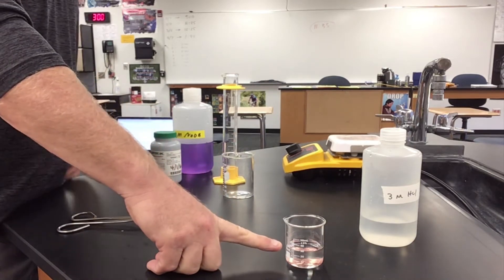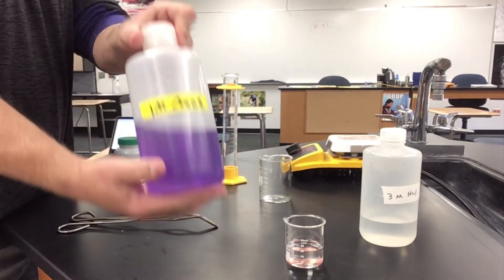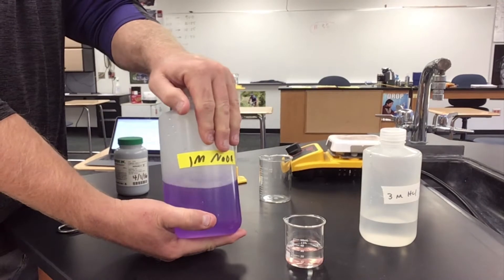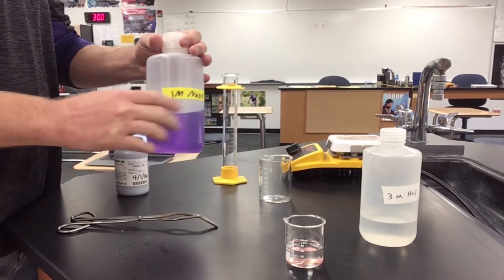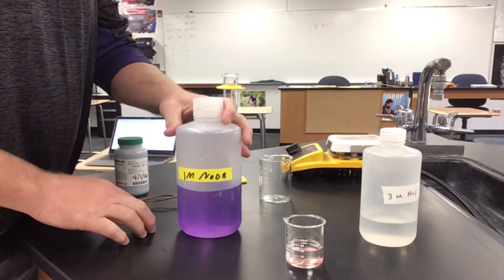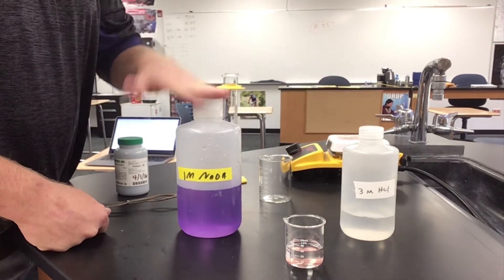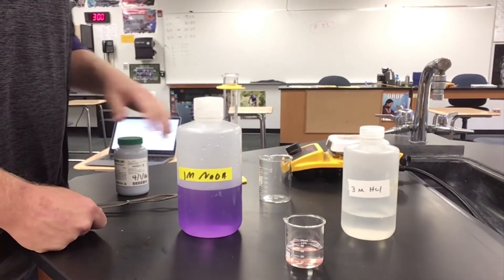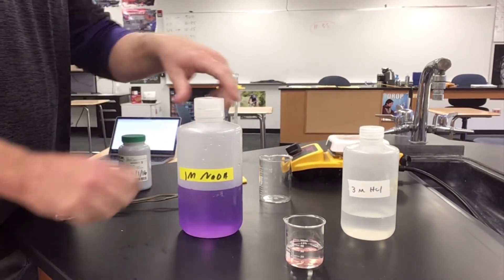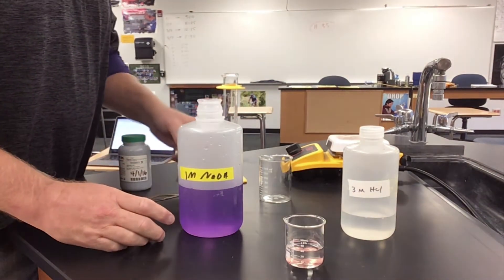While I wait for the pennies to get clean, I'm going to move on to the next part of the lab where I need 40 milliliters of one molar sodium hydroxide base. The one molar sodium hydroxide base is also a corrosive substance to human skin and organic material. There's sometimes a misconception that acids are bad for you and bases are not — in reality both solutions are very corrosive to organic material, so we want to make sure we do not get either on our skin or in our eyes.